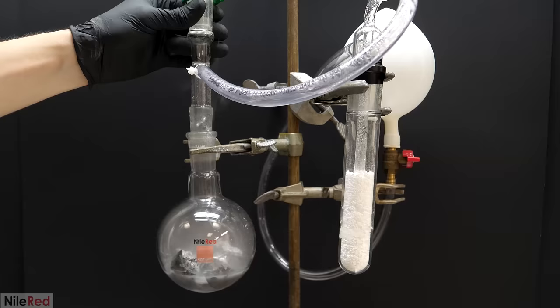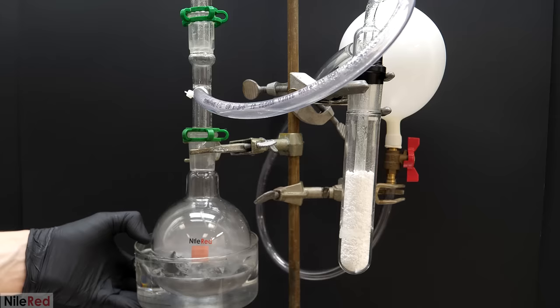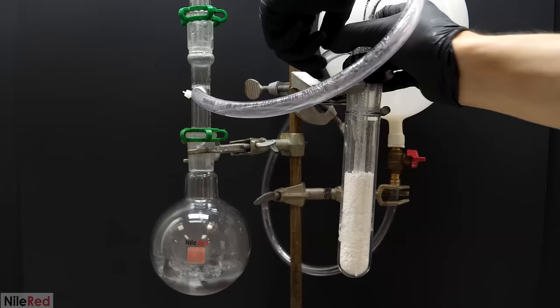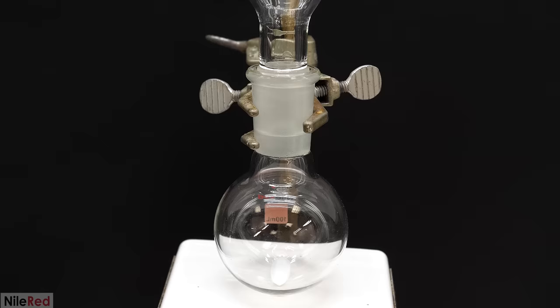This means that as the reaction continues things get hotter and hotter and more and more water is passed over with the hydrogen. For the most part the calcium chloride does a decent job at picking this up but it can very easily get overwhelmed. To deal with this one relatively easy method is to just put a condenser above the flask to try to recondense as much of the water as possible. I went for the even easier method though which was just to occasionally cool the flask with a bit of cold water in a bowl. But anyway with the hydrogen now ready I was able to move on to the actual reaction.